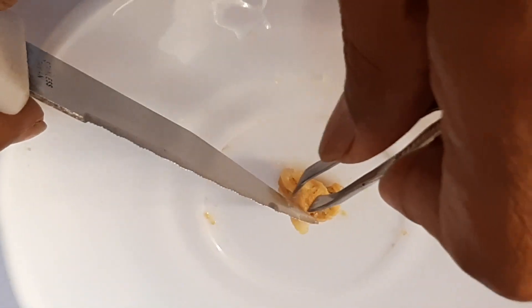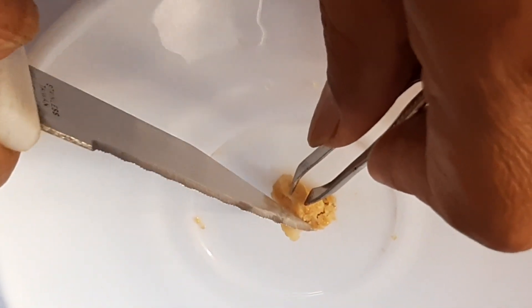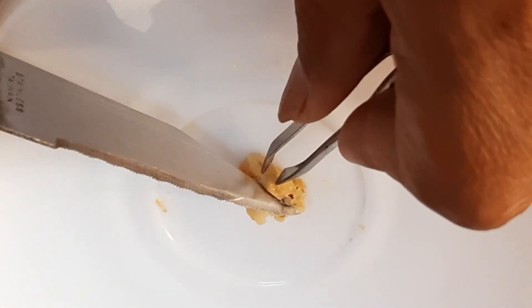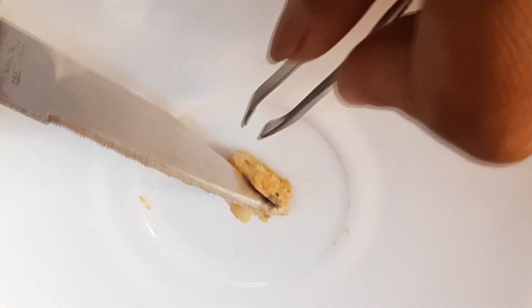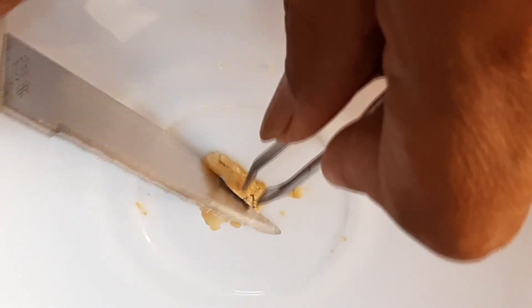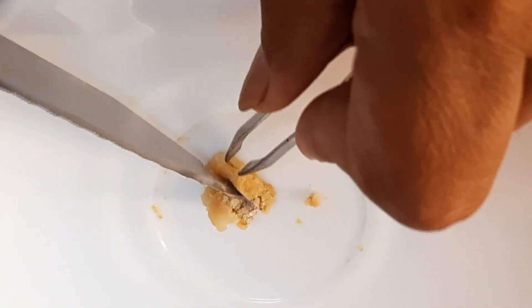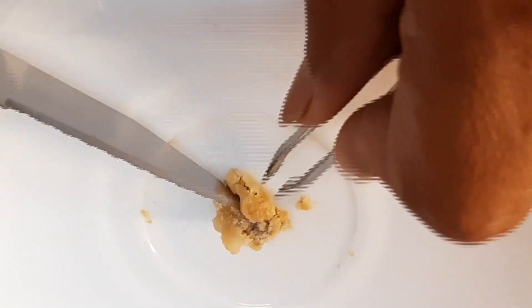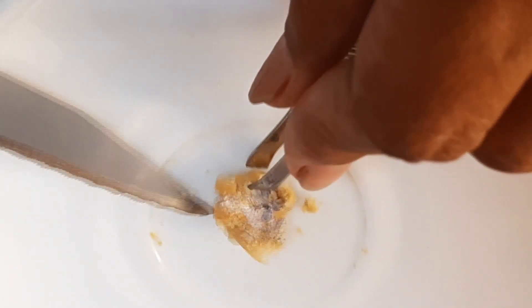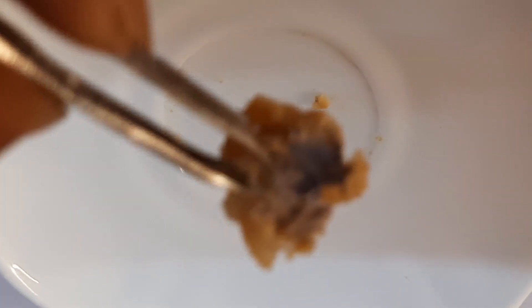Now watch this piece of sodium — I am going to cut it with the blunt side of the knife. You can see the sharp part is up. Because sodium has a larger atomic size and less binding energy, it is soft. I will open this and you will see the shiny part — it gets tarnished immediately.